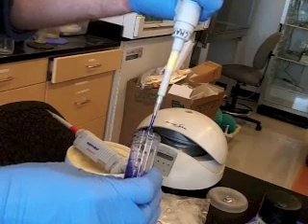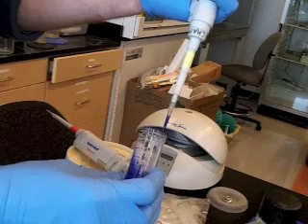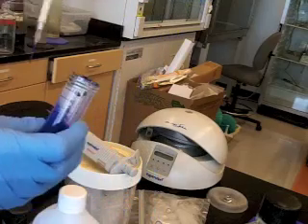And when you're dispensing, you just want to release the volume smoothly like that. And now is when you can push the plunger down further past that first stop to make sure that you get everything expelled like that.